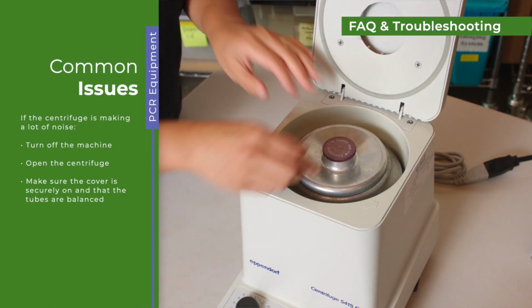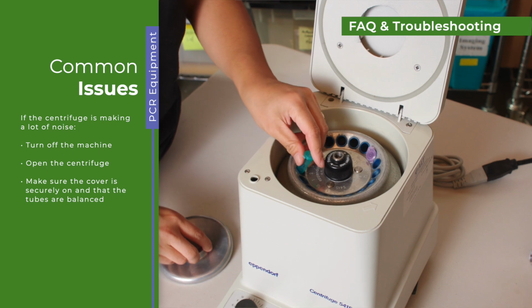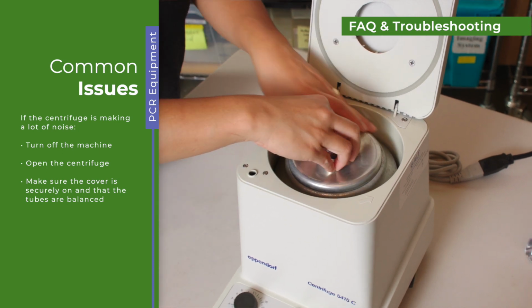There are some common issues when working with the PCR equipment. If the centrifuge is making a lot of noise, turn off the machine, open the centrifuge, make sure the cover is securely on and that the tubes are balanced.